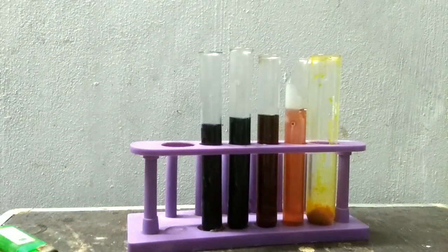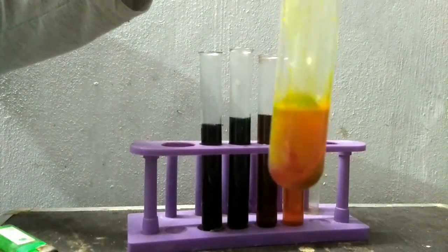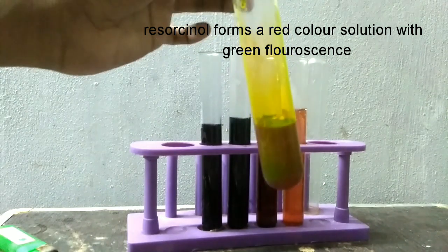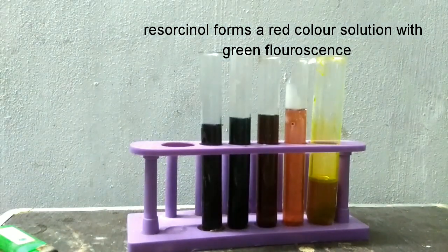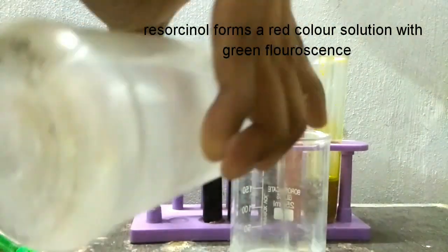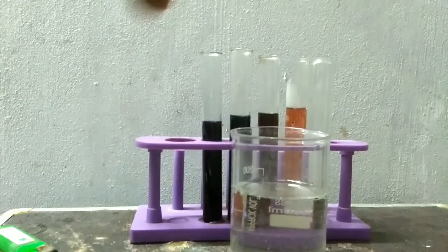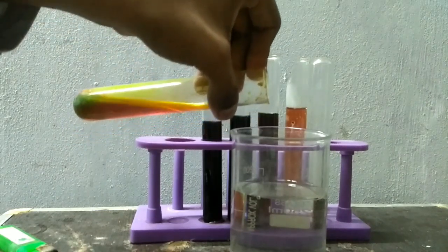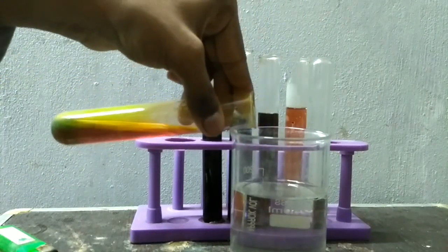You get a fluorescent solution. Now add this fluorescent solution into a beaker containing water. Add a few drops only.